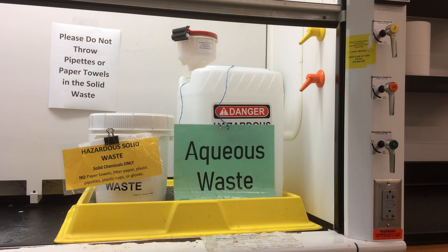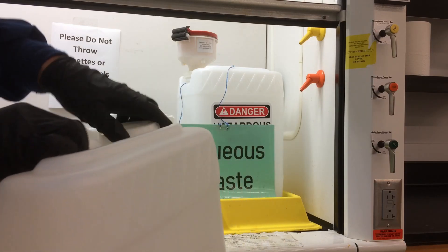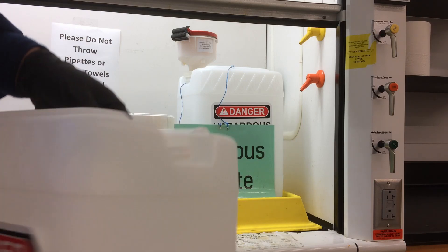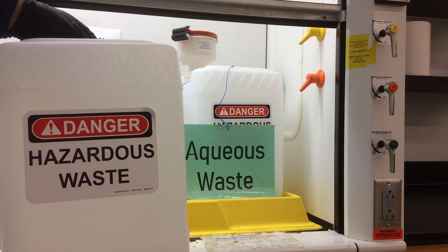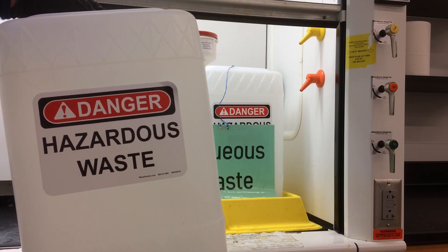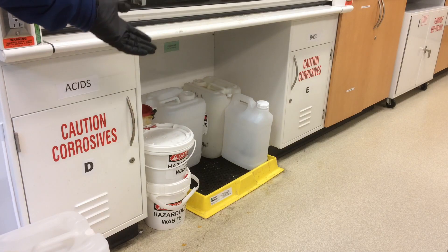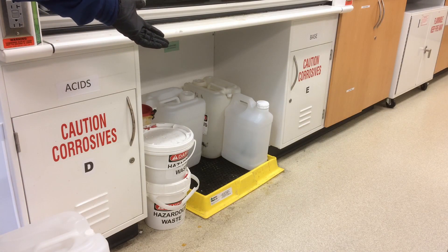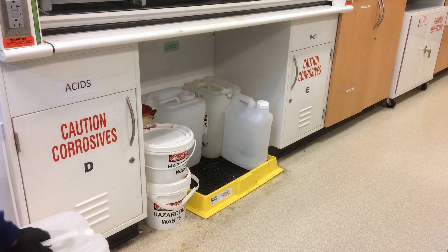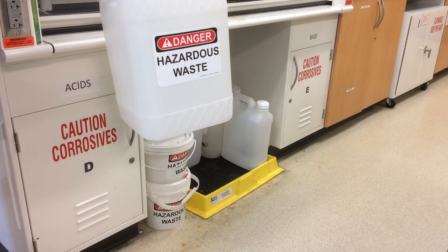You put these signs on the container, then you take this full tank to the Hazardous Waste Satellite Accumulation Area, abbreviated SAA. This is the SAA area for the RSA room 1062 lab. You place this full waste tank here, and the EHS personnel will come to pick it up.